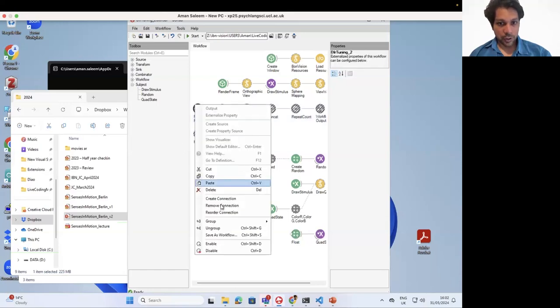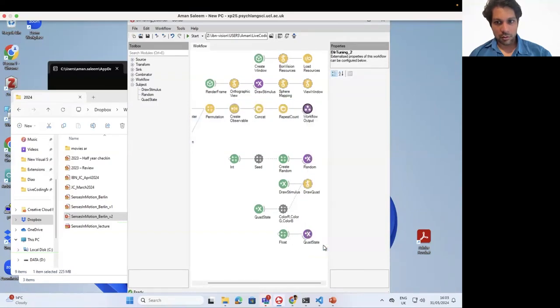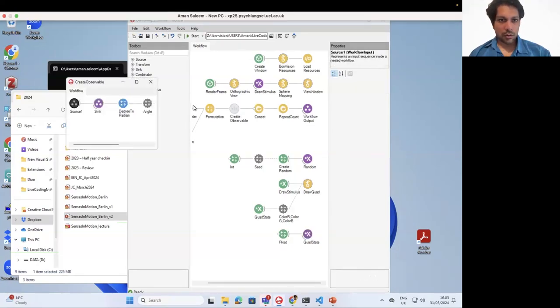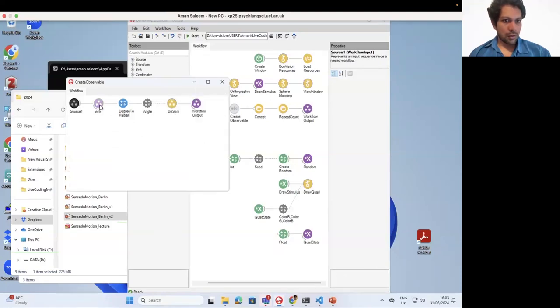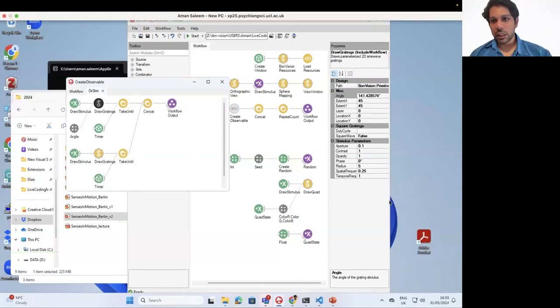So I'm going to activate this again, so I'll enable this to happen. I'm just going to make this just 2 repeats. That's easier. Okay, so now this is this variable called quad state. Take this out. Okay, so you've got draw gratings, take until this timer, and then you go at this other draw gratings, which is the 0 contrast stimulus. So we can just say every time this specific draw gratings, which is a full contrast stimulus, is on, every time this goes, we want it to go white, and every time this goes, we want it to go black.